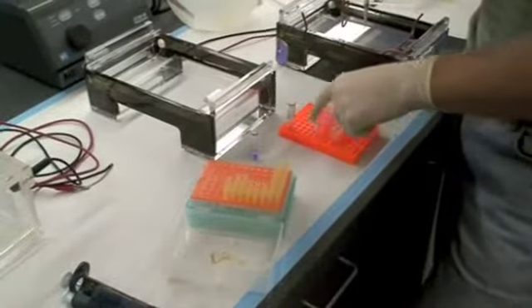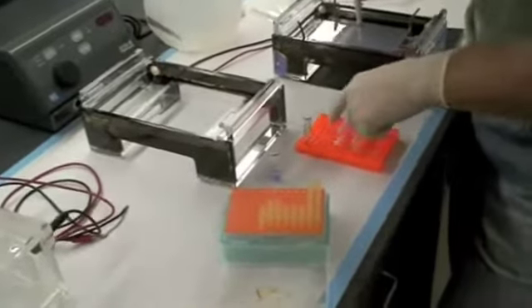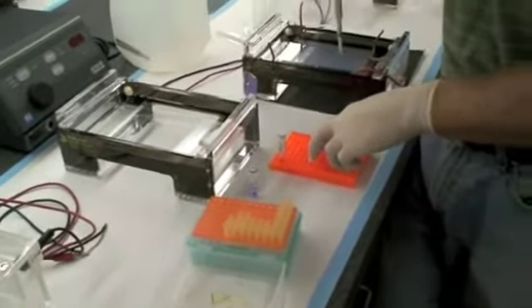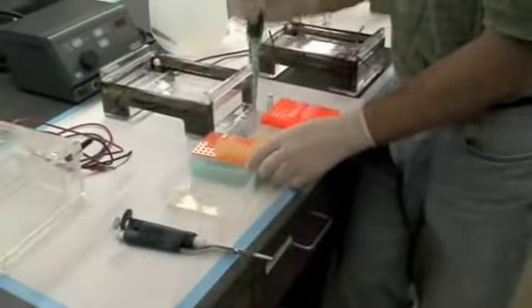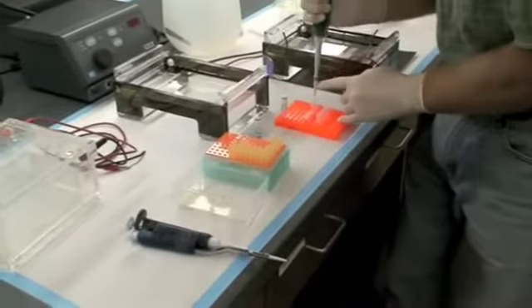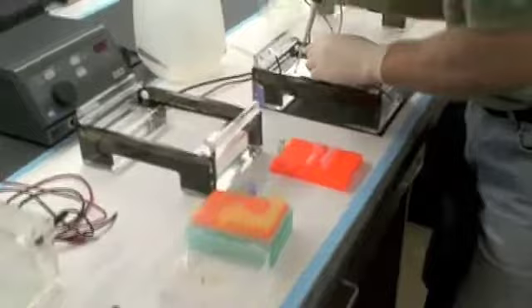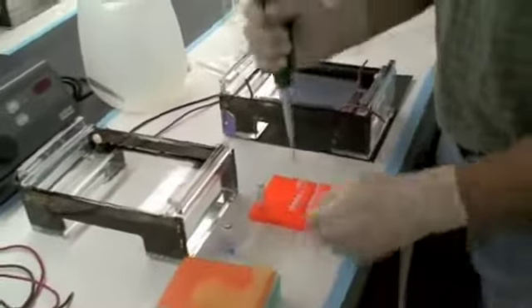These tube racks are also eight across. So instead of the empty tips going white, there's still some blue at the bottom. What I can do is either shut the lids, I know that I've done these. Or I'm on number four here, I do number four here. I can keep track of which sample I'm on by the tip.